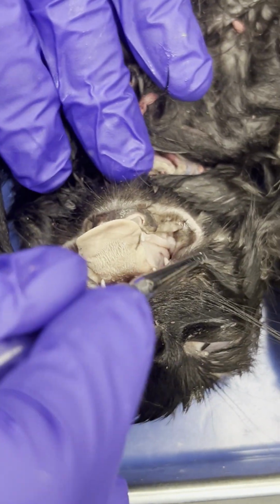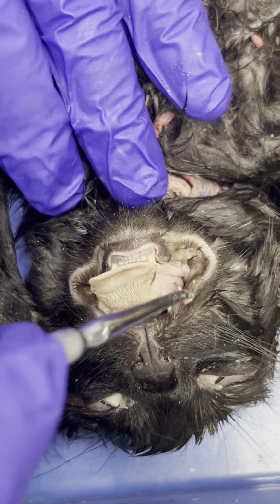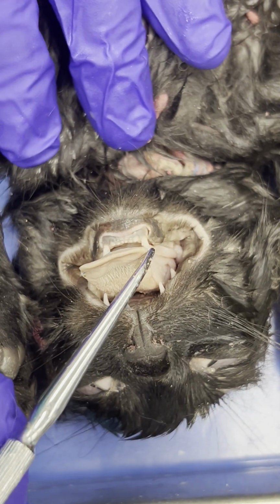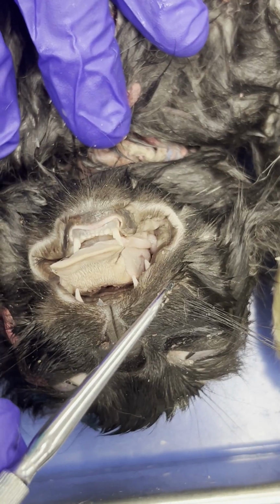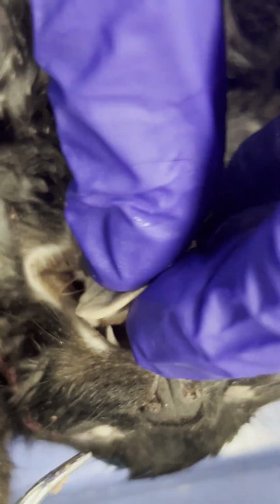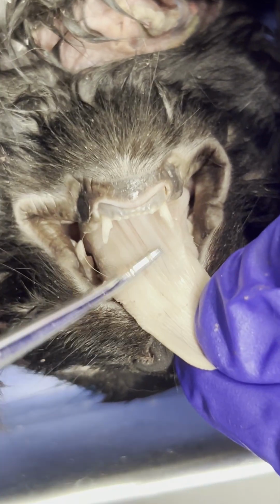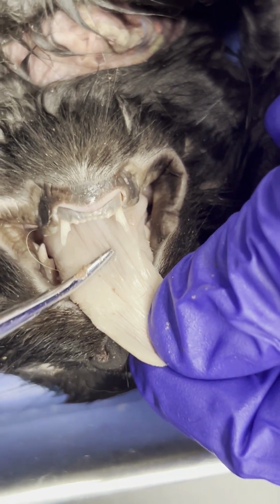We have the buccal cavity. This should be a term that I think you guys were introduced to when we were going over the lamprey. So buccal cavity is essentially the mouth of the cat, the entire mouth of the cat in this case. Then we have the lingual frenulum. Lingual frenulum, it connects the tongue. So here's the tongue. Hopefully you guys all know that. It connects the tongue to the underlying tissue. So right here. So lingual frenulum.